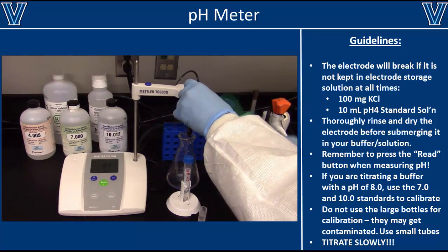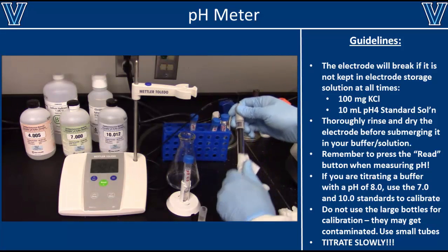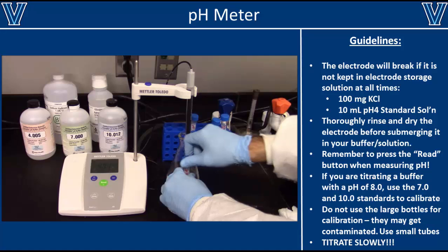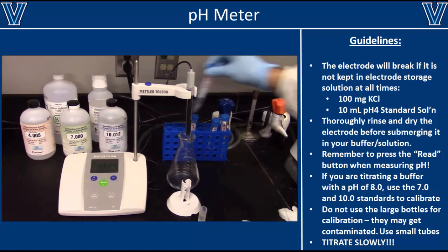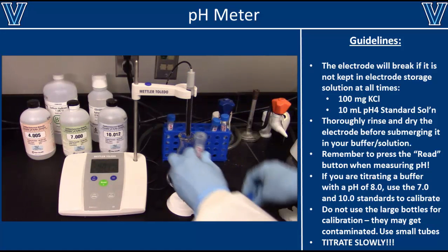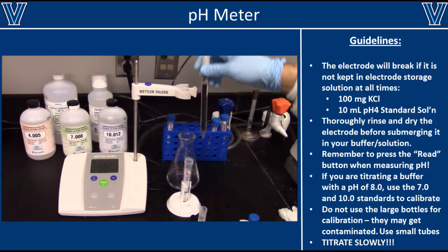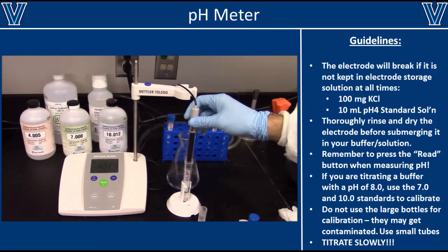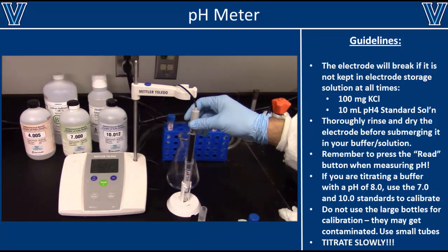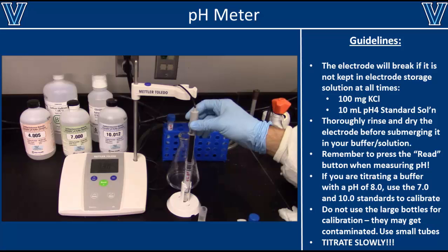When calibrating the meter, it is important that you use the two standard solutions that are closest to the pH of your buffer. For example, if you plan on making a sample with a pH of 6, you'll want to calibrate with the 4 and 7 standards. However, if the pH of your buffer will be 8.5, then you'll want to calibrate the meter with the pH 7 and 10 standard solutions.